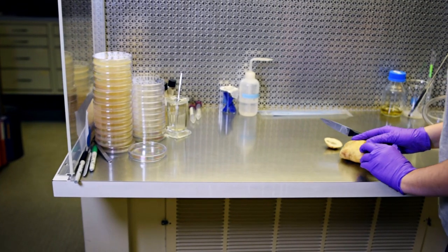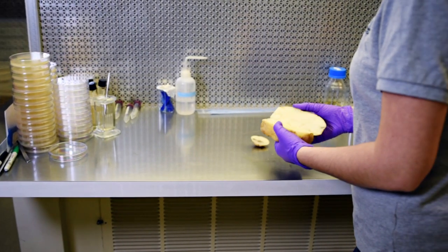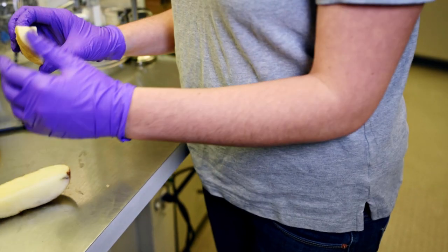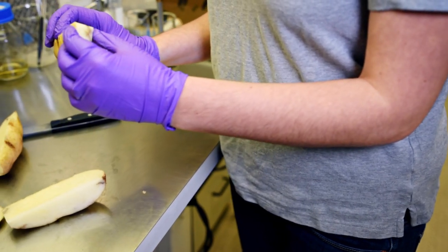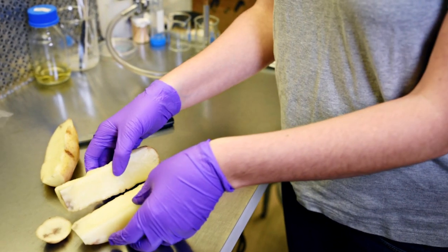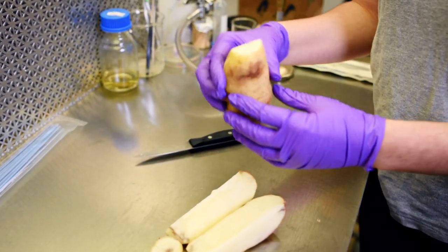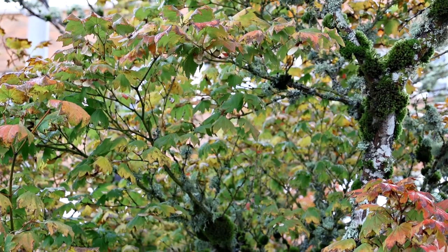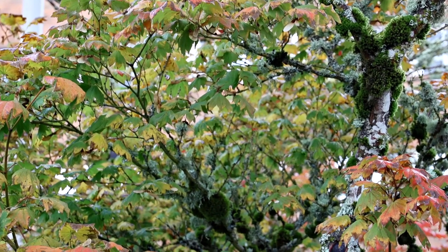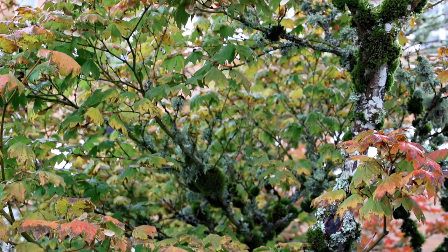We get a variety of different plants that come in through our door to get diagnosed. We go through plenty of potatoes but we also get plenty of other vegetables like carrots and beans. We diagnose some trees and ornamentals and also some diseases that are spread by insect vectors here in the Columbia Basin.